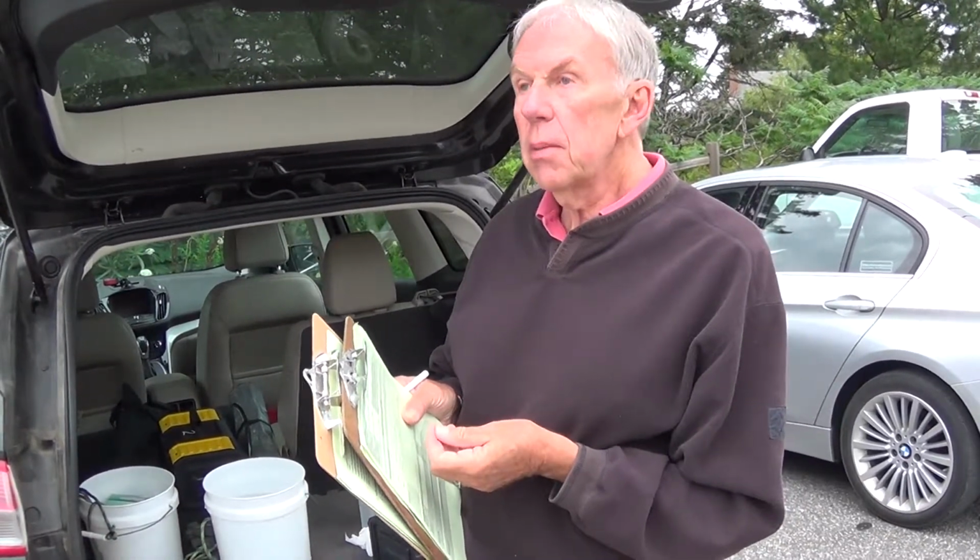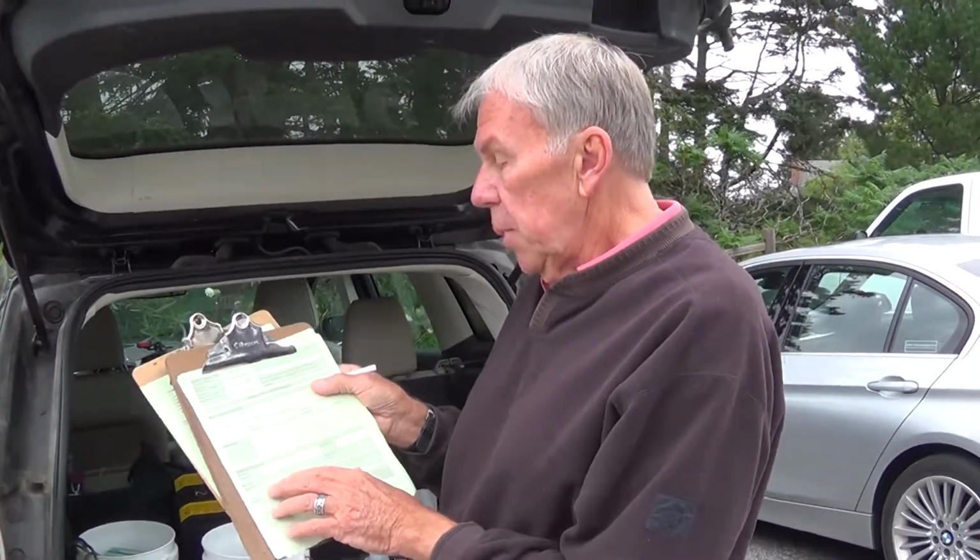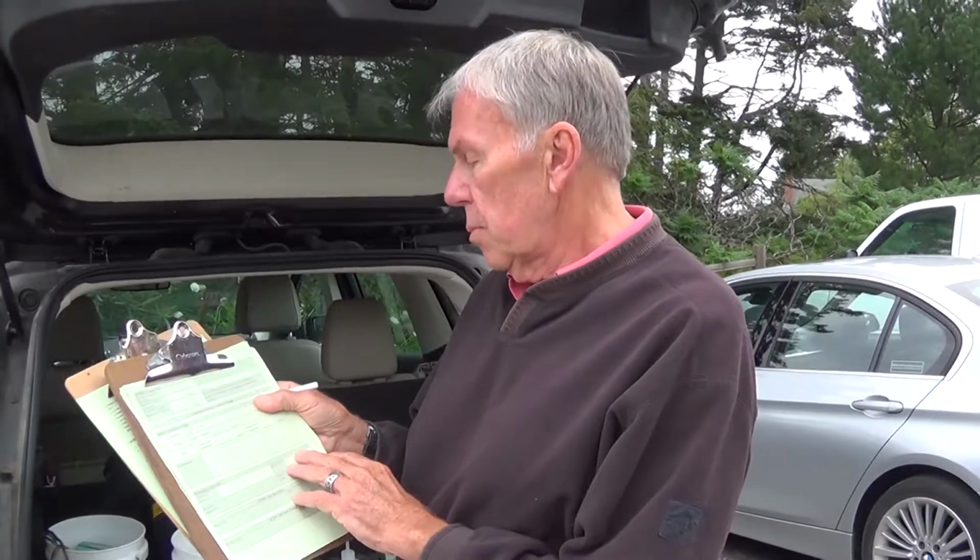After you've taken that reading for dissolved oxygen, you rinse it off, you put the cap back on, you shut it off, and then you begin the whole process again. And that whole process is to recalibrate it, to inspect it, to calibrate it, and then to take the sample. The last thing to do is basically to sign your name, give the end time, and turn it into the Land Trust office. All right? Okay.